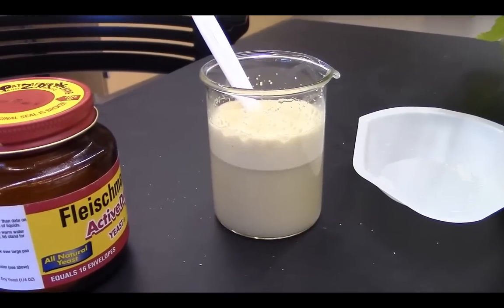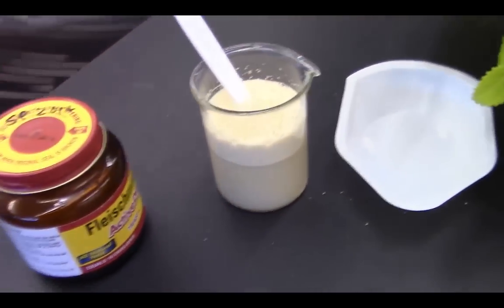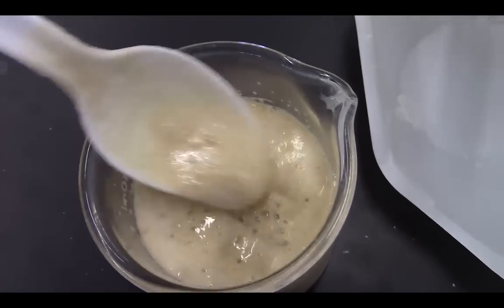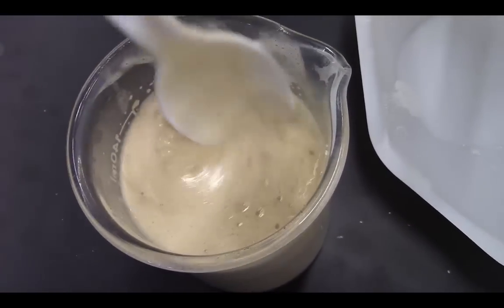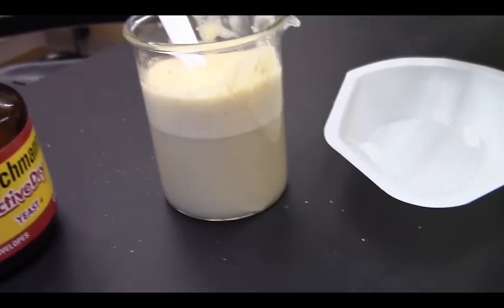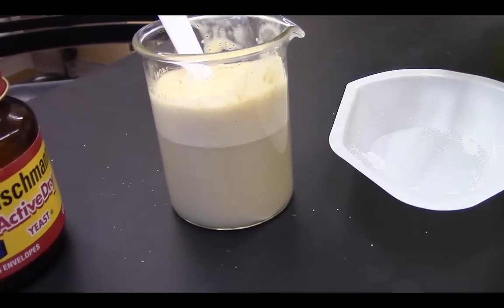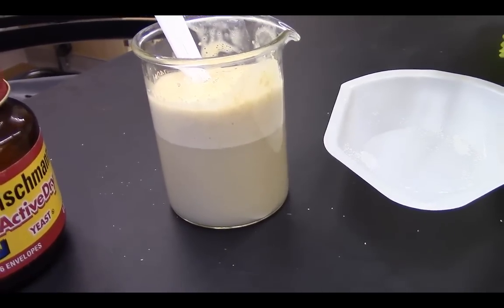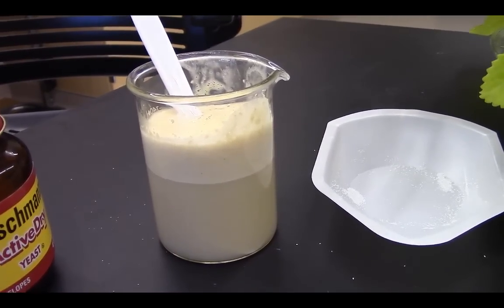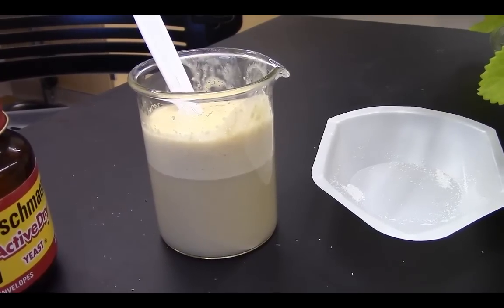It looks like we have a lot of foam that's been generated here. Notice how bubbly and thick that is. All of those bubbles being produced are the byproduct of cellular respiration or fermentation, which is carbon dioxide. I think if we left that beaker for another 15 minutes, it would overflow with this bubbly froth — and the gas contained within that froth is carbon dioxide.